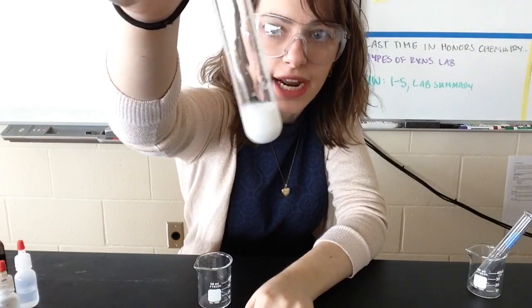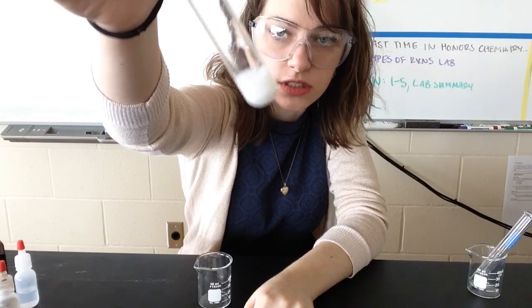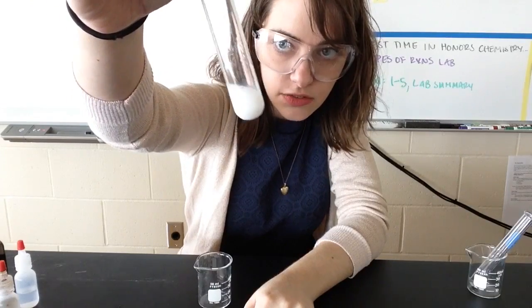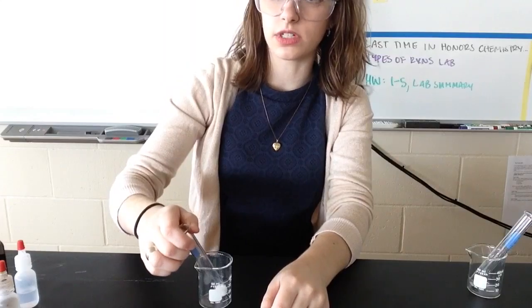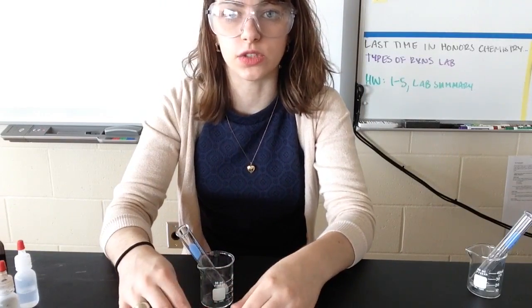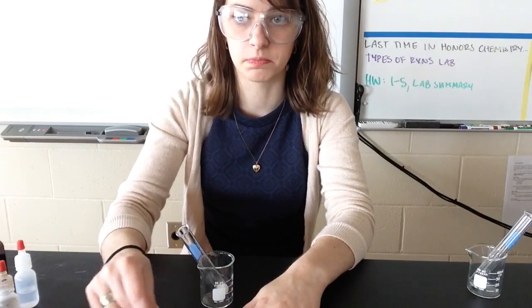And so here's what that reaction looks like. Remember, those two solutions were clear to begin with. I can kind of see a solid forming on the bottom. If I were to let that sit, I will put a picture in after this video as to what this looks like after it sits for several minutes.